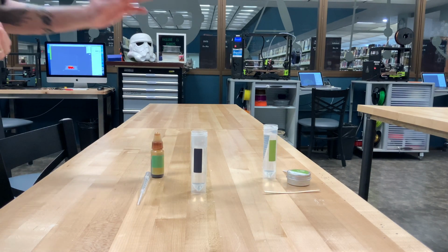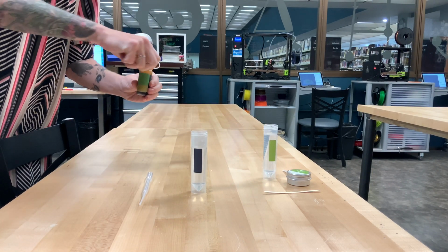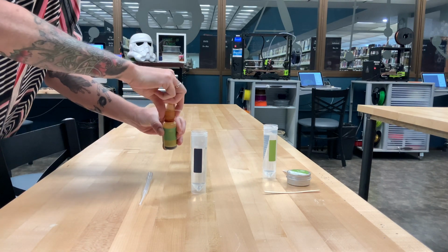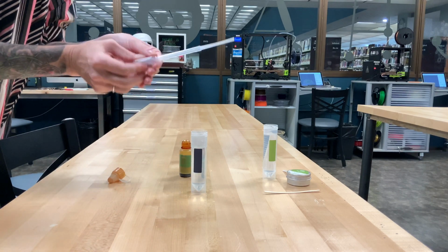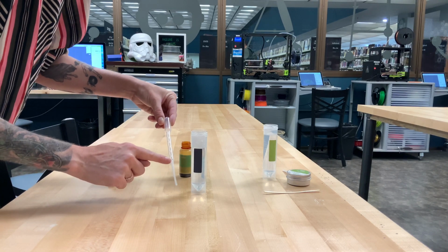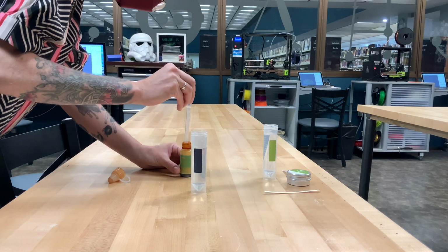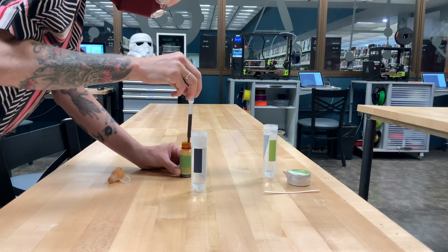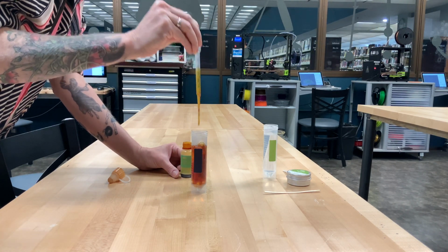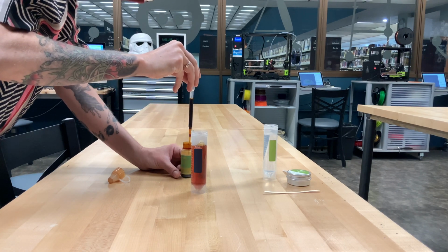Okay, so now we are going to take 2 beakers that have warm water in them, and the first one we are going to add some iodine to. And you can see that's kind of a dark liquid. It's going to turn all of our water that darker color. We're going to use this pipette, which has measurements on the side. It goes up to 3 milliliters, and we're going to need 5, so I'll do this twice. First milliliter goes in, and then I'm going to grab a little bit more. Not quite that much. There we go.